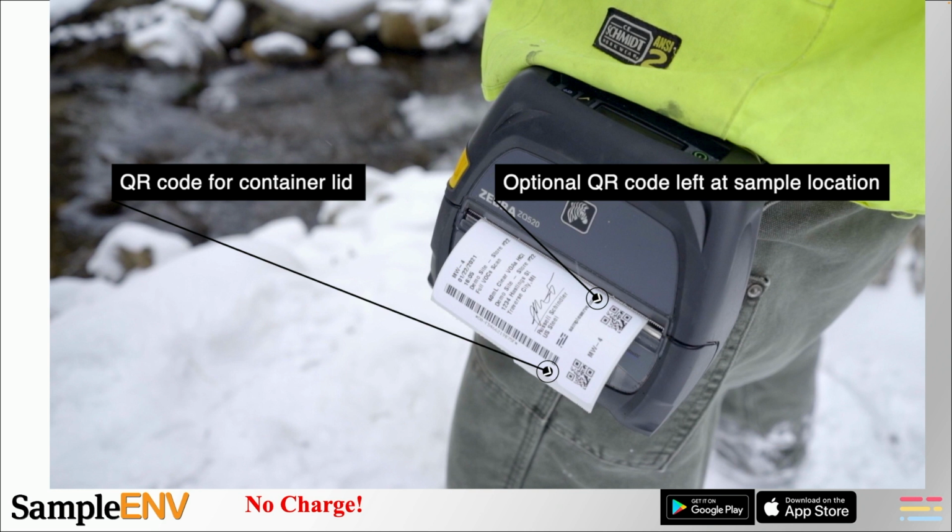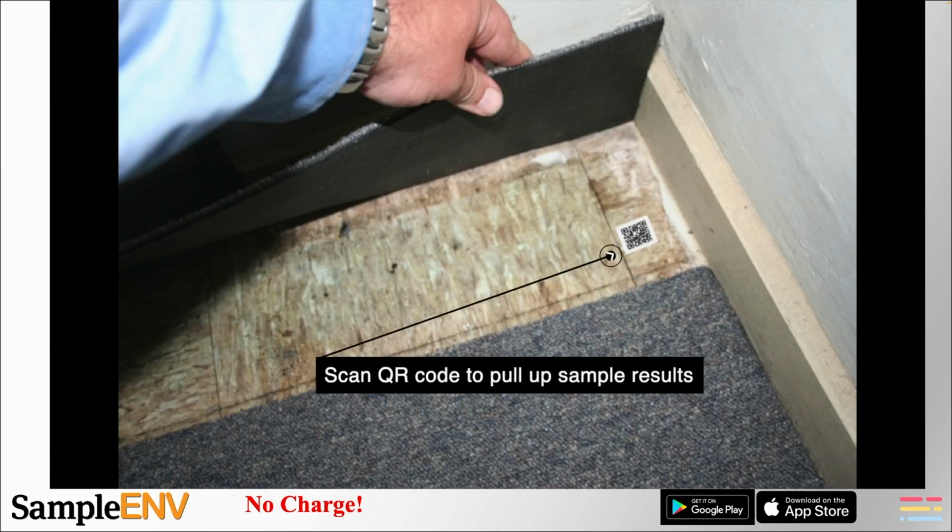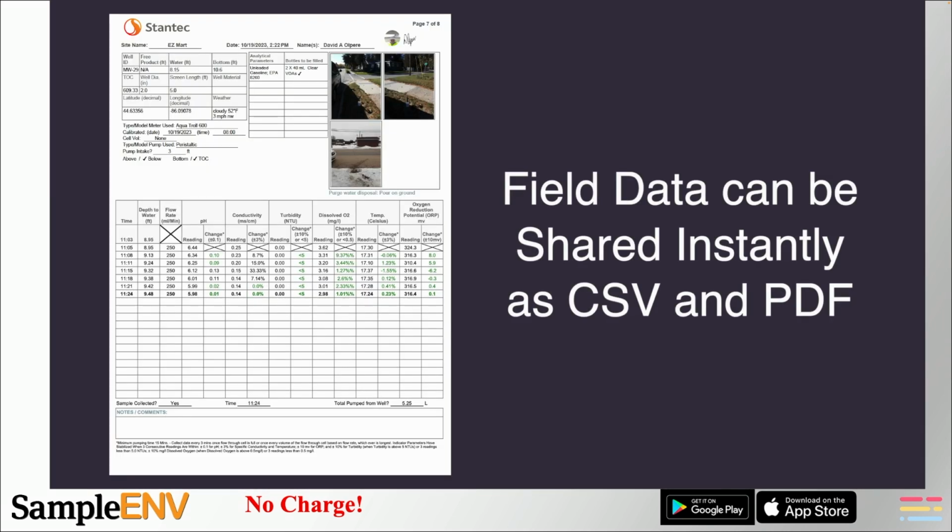The 2 QR codes are designed so that one is placed on the lid of the sample bottle and the second one, which is optional, can be left at the sample location. Let's say you're sampling for asbestos. You can come back to that sample location after lab results have been posted, scan that QR code, and view the analytical results for that sample location.